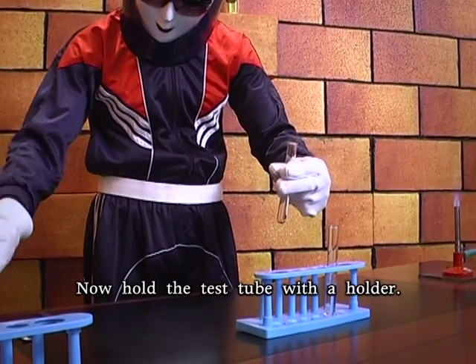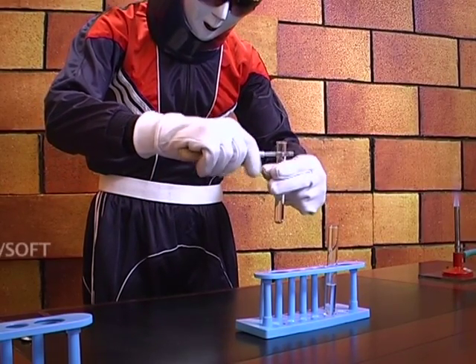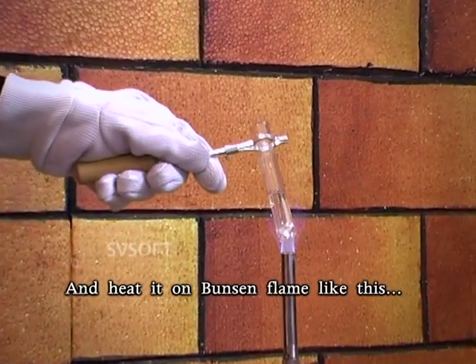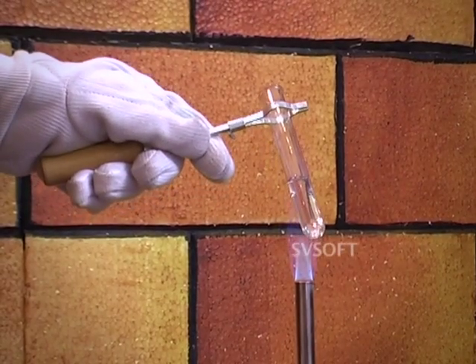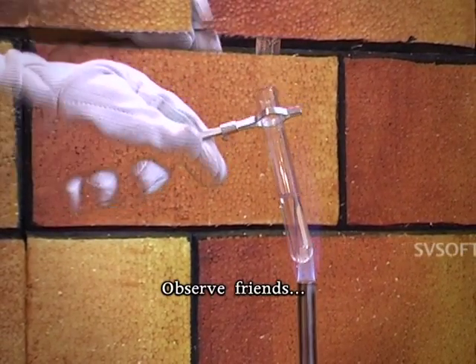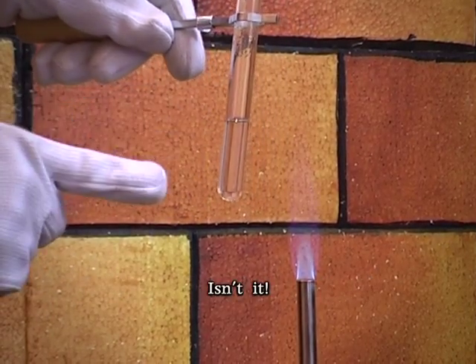Now hold the test tube with a holder, and heat it on the Bunsen flame like this. Observe, friends, some more clear solution is formed, isn't it?